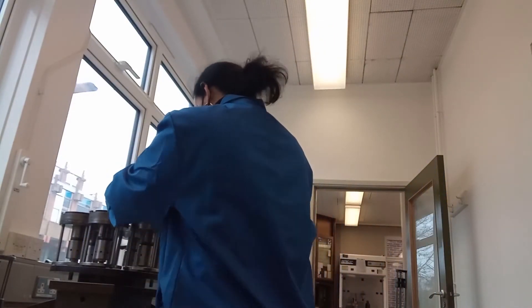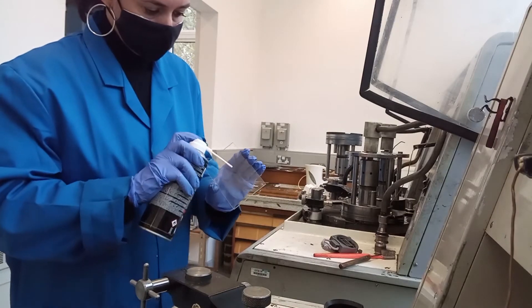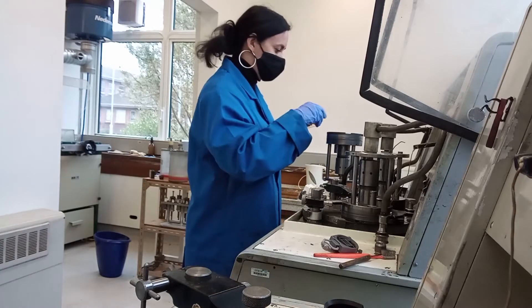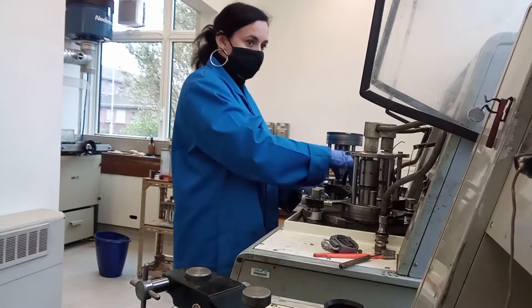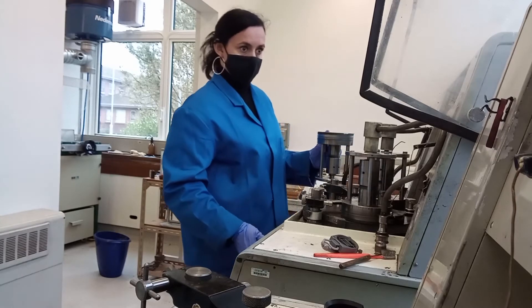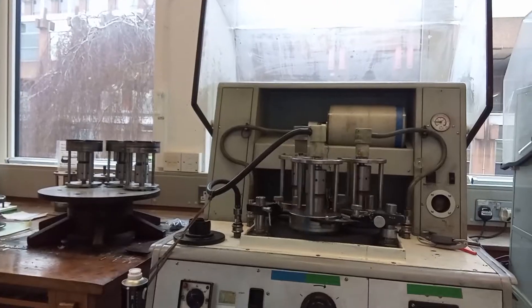The surface of the glass slides is also flattened using a precision lapping machine called the Logitech. The slabs will be bonded to the glass slides so it is important that both are as flat as possible to give a good finish. The jigs are calibrated to 2.7 millimetres and the slides are held onto the jigs by a vacuum. The slides are lapped in a solution made up of water and aluminium oxide, whose particles are suspended in the water to act as an abrasive.